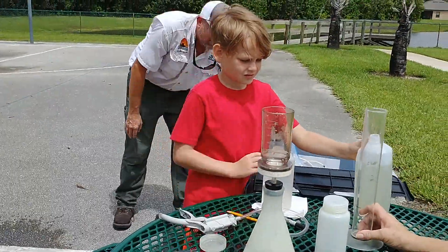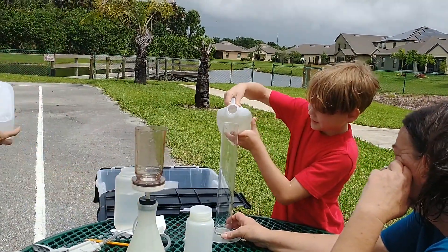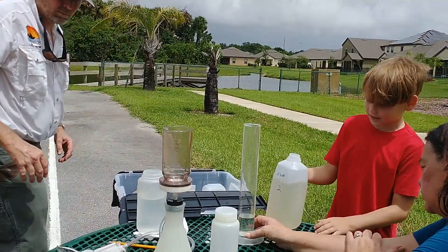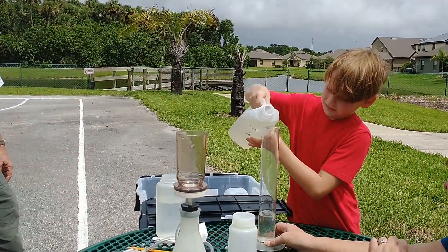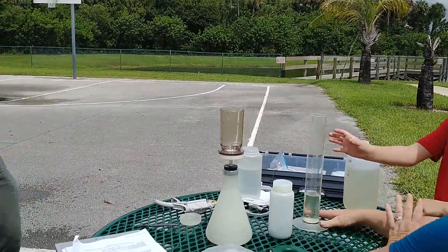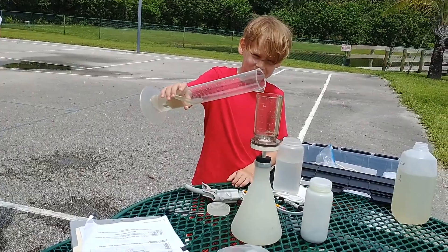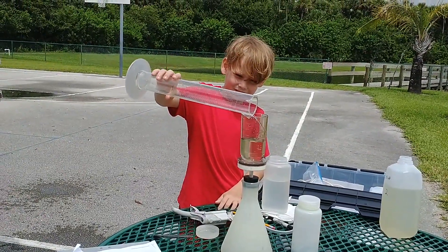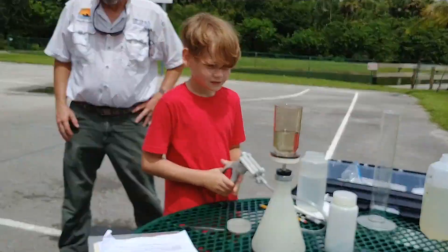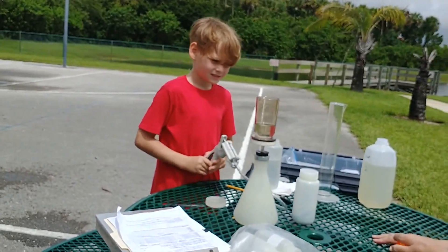So now what do we need? More water — it's already rinsed, so you just got to go to 150. You want it on this side so you don't spill anything. Keep going. Now we're going to start it — there's a little water, that's fine. Okay, pour it in. So we didn't have to empty it. All the way in. Now stop — see, now we're not leaking. If we lose any water we've got to start over. Going down pretty fast.